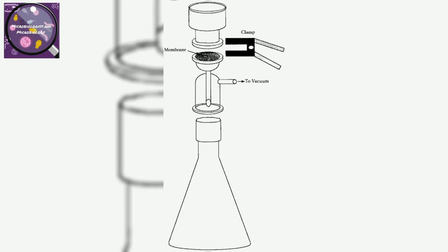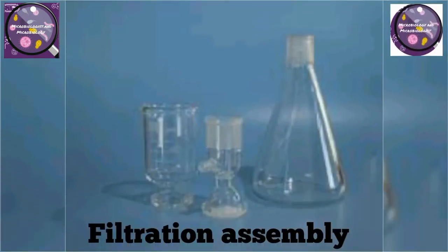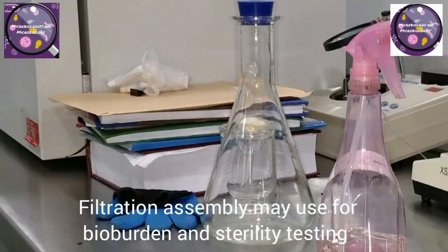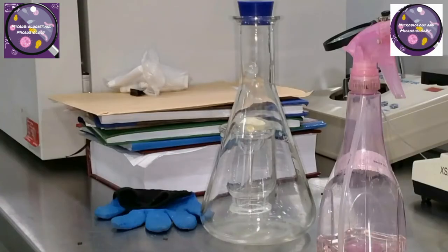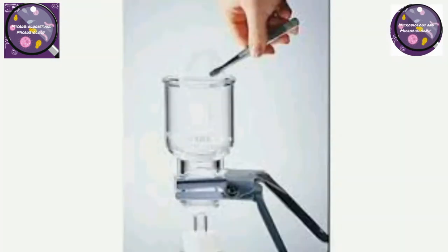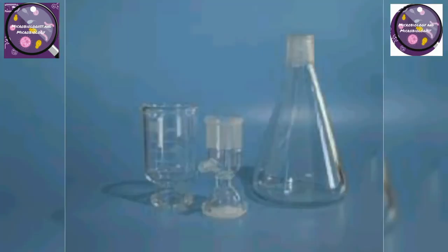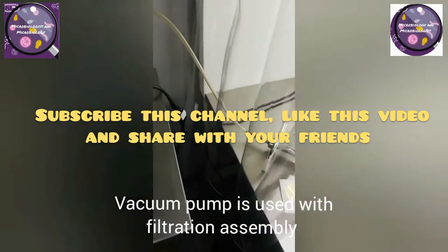Here is a clip from my previous video. Filtration assembly is used in some testing methods like bio burden of products and sterility testing of sterile products. There are different assemblies available in the market, such as with one chamber, two chambers, etc. We use membrane filtration paper, vacuum pump, and flask with the filtration assembly chamber.